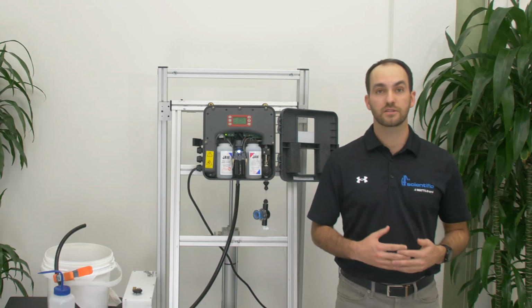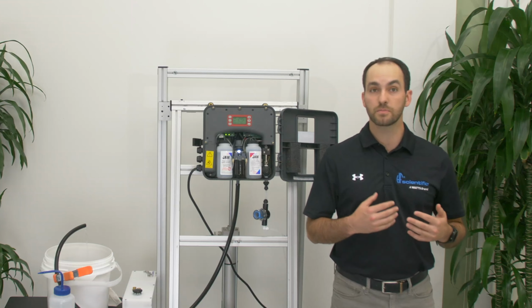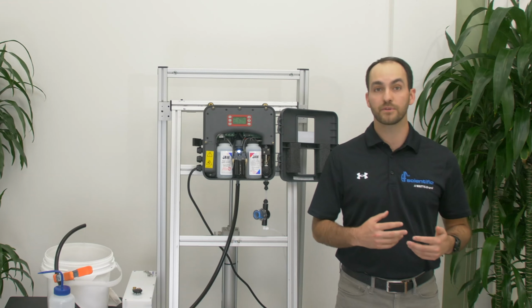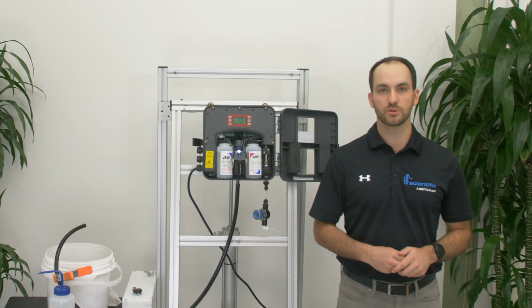Having a tube attached to the bottom of the analyzer can cause back pressure in the line and not allow the analyzer to drain. Air gap the drain as the first line of defense in troubleshooting.